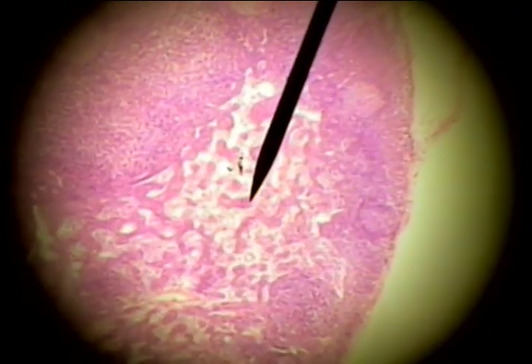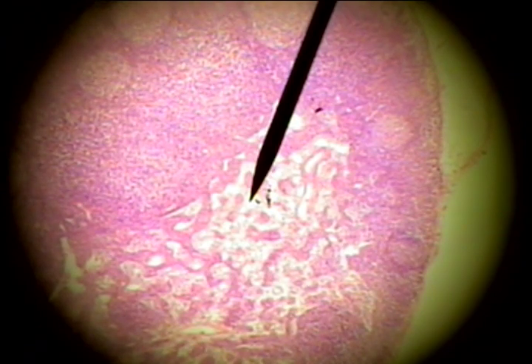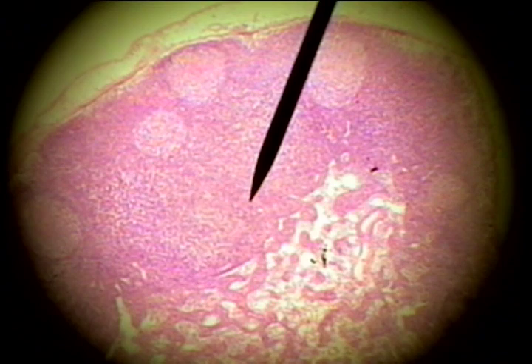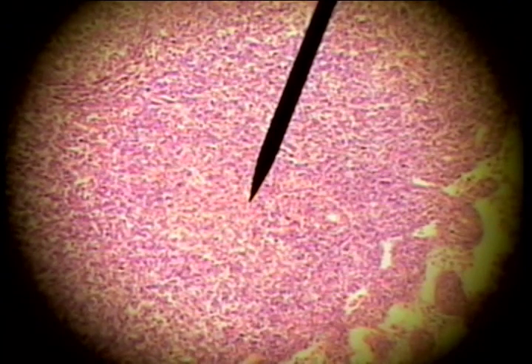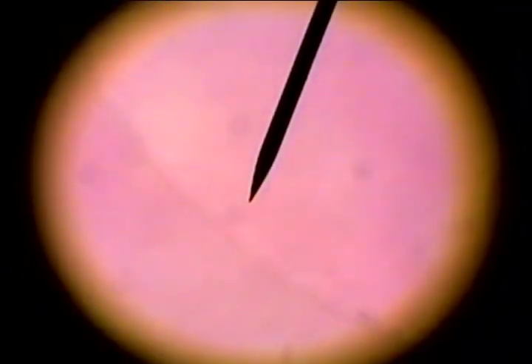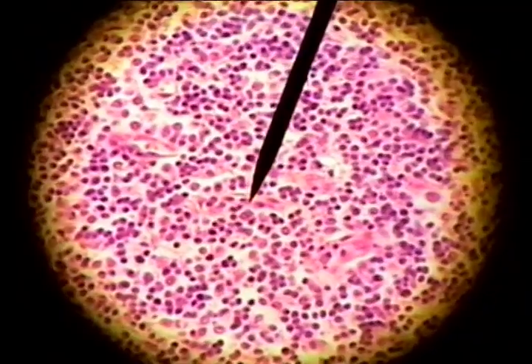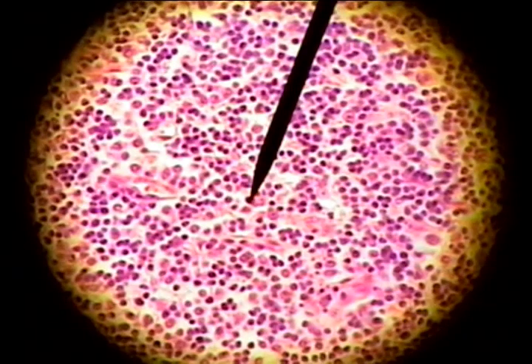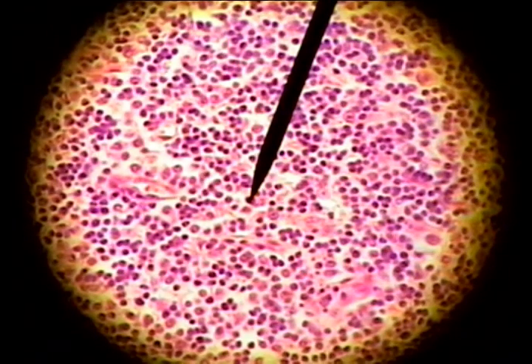The lymph fluid can come in contact with the key cell of the lymph node, which is the lymphocyte. The lymphocyte has the appearance of a dark blue dot because the cytoplasm is not easily seen — it is small and the nucleus is very prominent.